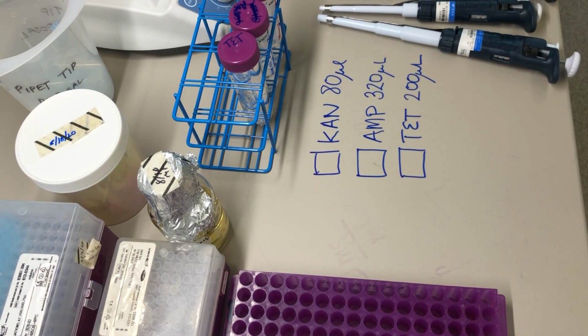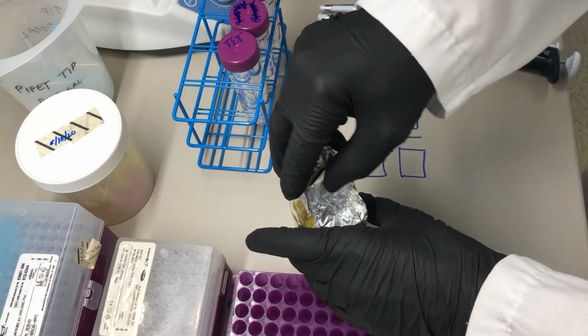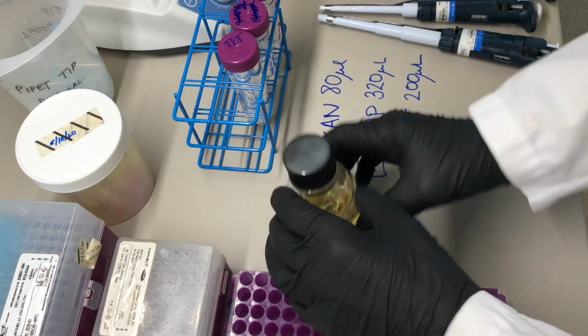This is Mutate DNA, day 1, and this video will show how to set up and start your overnight cultures of bacteria that are expressing MutY with some kind of difference in the MutY structure. We're going to begin by adding antibiotics to 80 milliliters of the LB media.